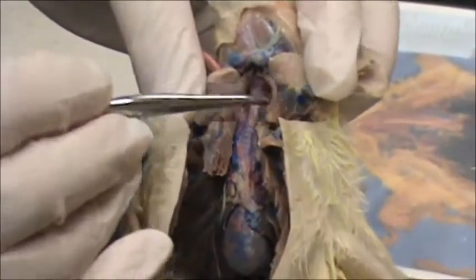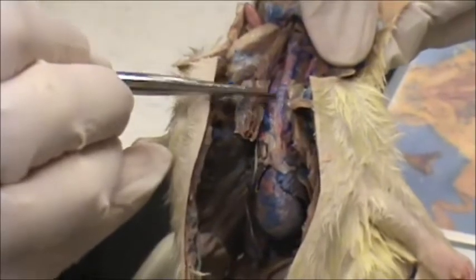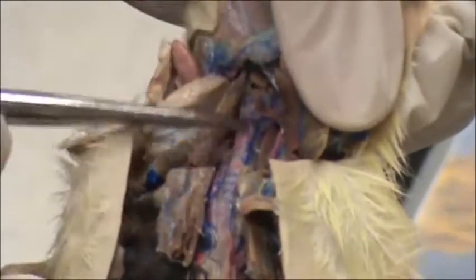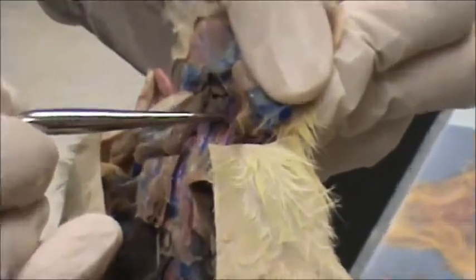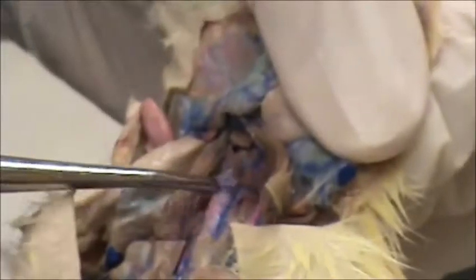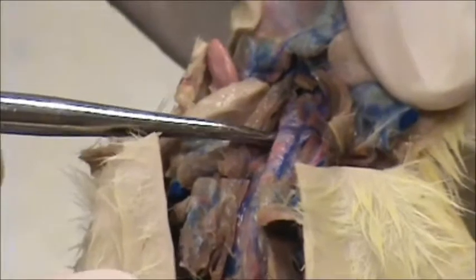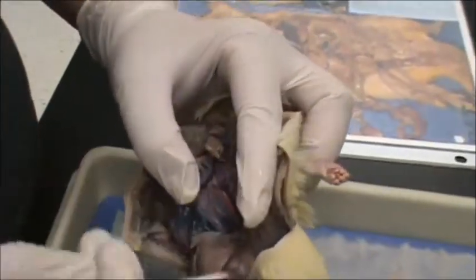Here are the muscles, and I peeled those back so you can see the trachea. The trachea has these rings of cartilage that make it stiff so that it doesn't collapse, and so you can breathe air in and out through the lungs. Right here is this little brown strip, and that is the thyroid gland. The thyroid gland regulates calcium and metabolism. The esophagus is below this, under the lungs, and you will find the esophagus leading to the stomach.